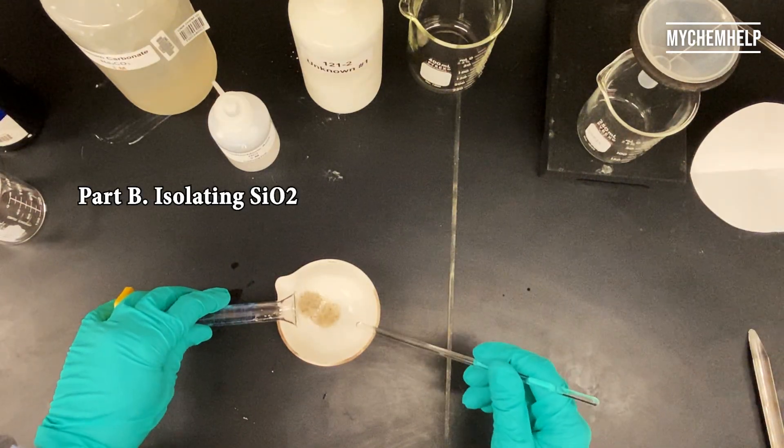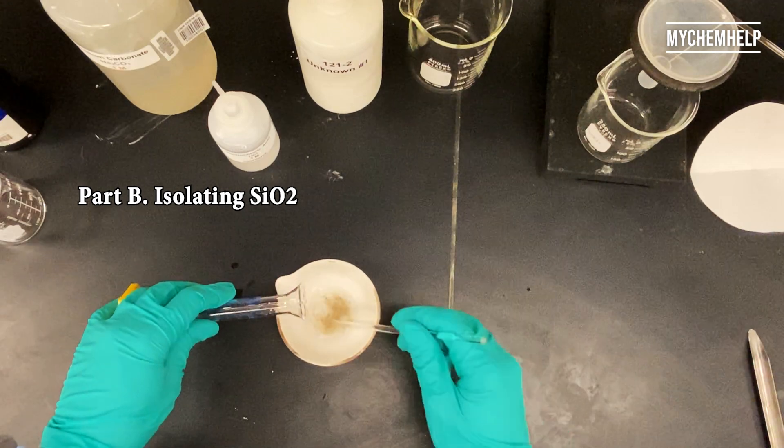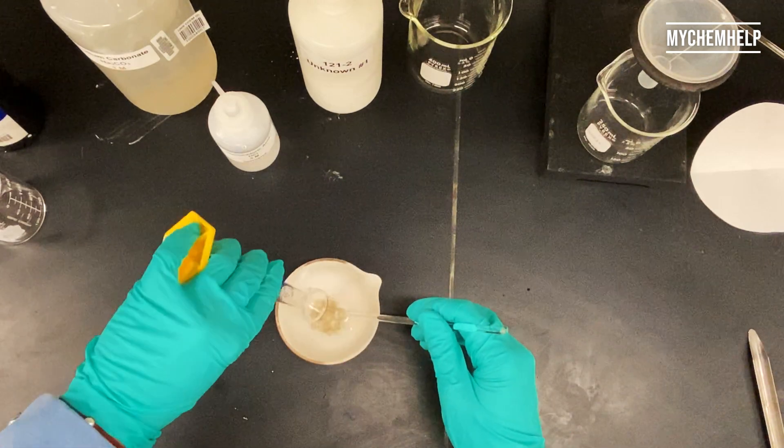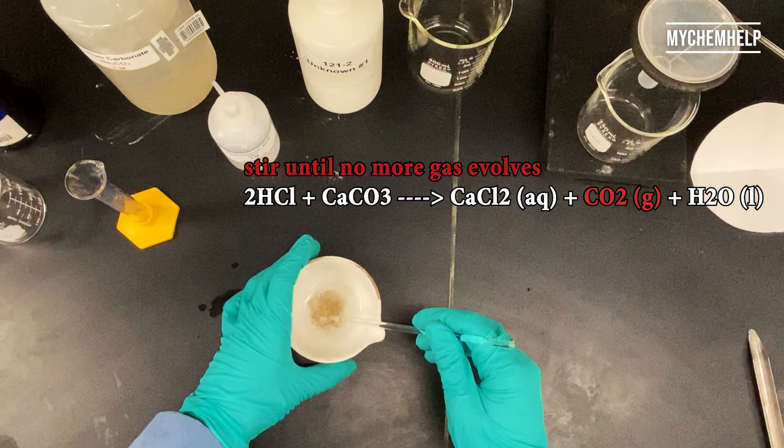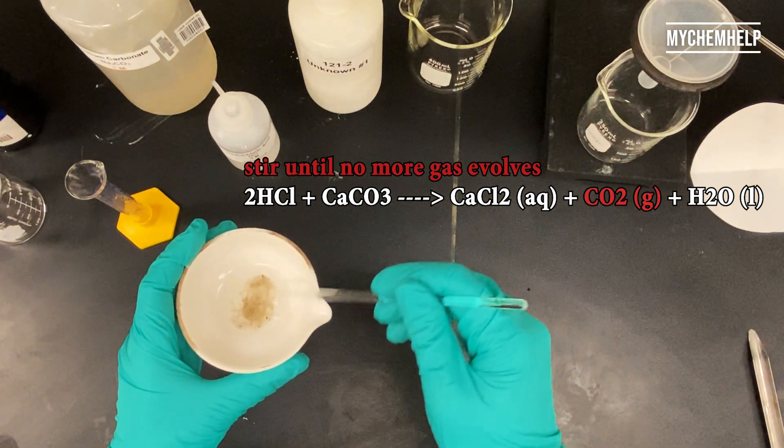So part B, isolating the sand, I'm pouring in some hydrochloric acid into the evaporating dish, and I'm stirring until no more gas evolves.